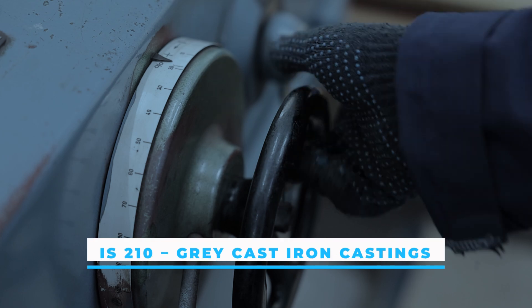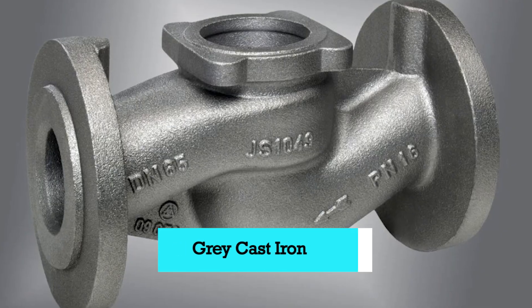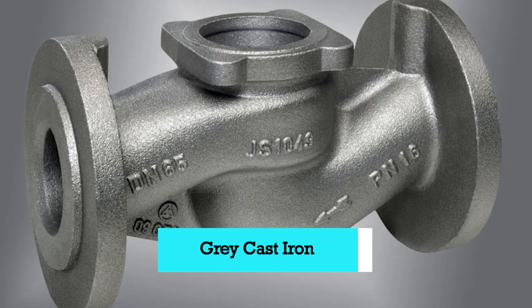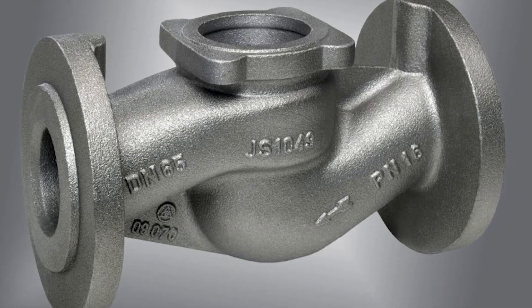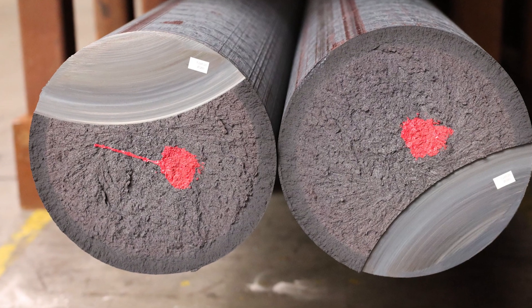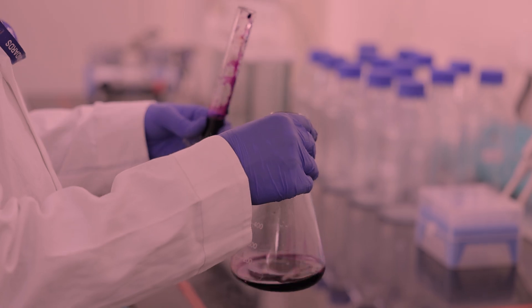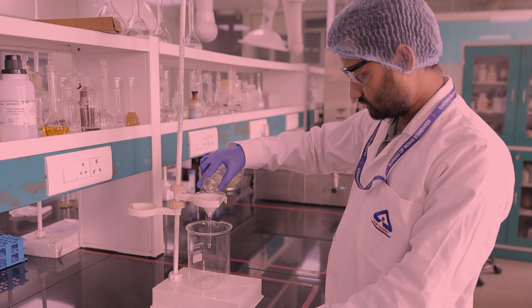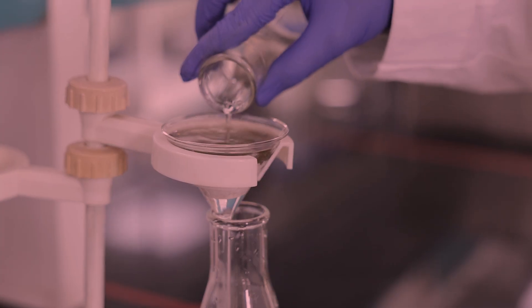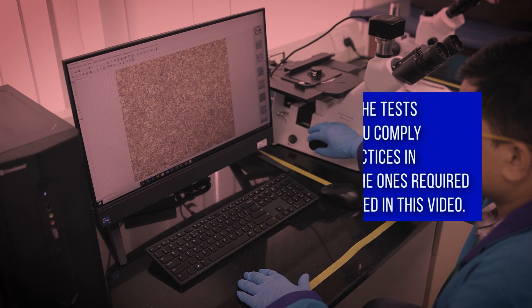This video explains the tests conducted as per IS-210-2009 for Grey Cast Iron, an Indian standard developed by the Pig Iron and Cast Iron sectional committee under the Metallurgical Engineering Department at BIS. Before performing the tests, please make sure you comply with the safety practices in your lab and also the ones required for the tests specified in this video.